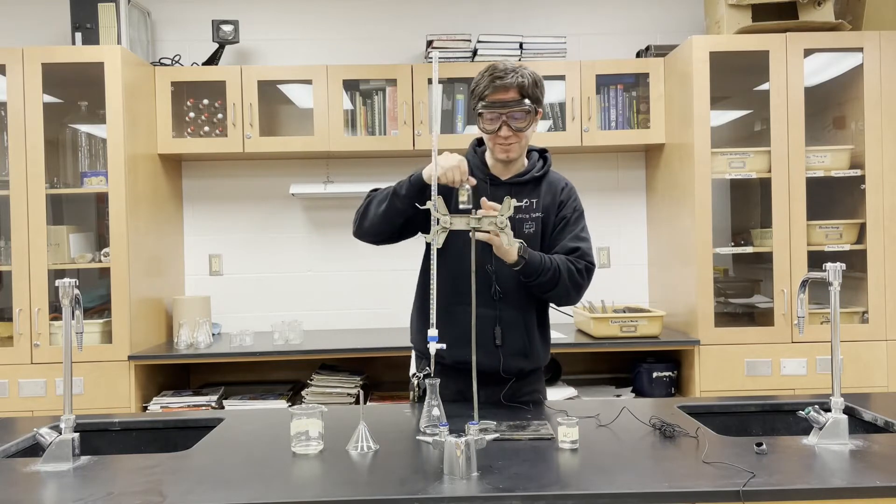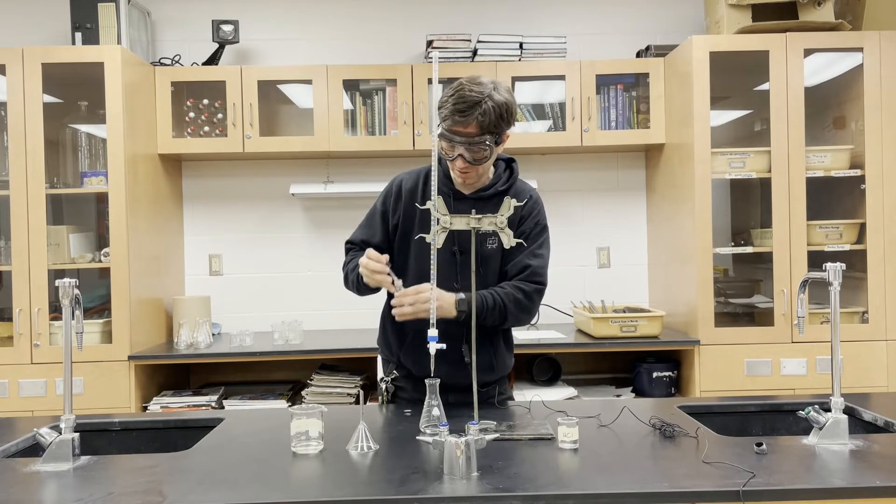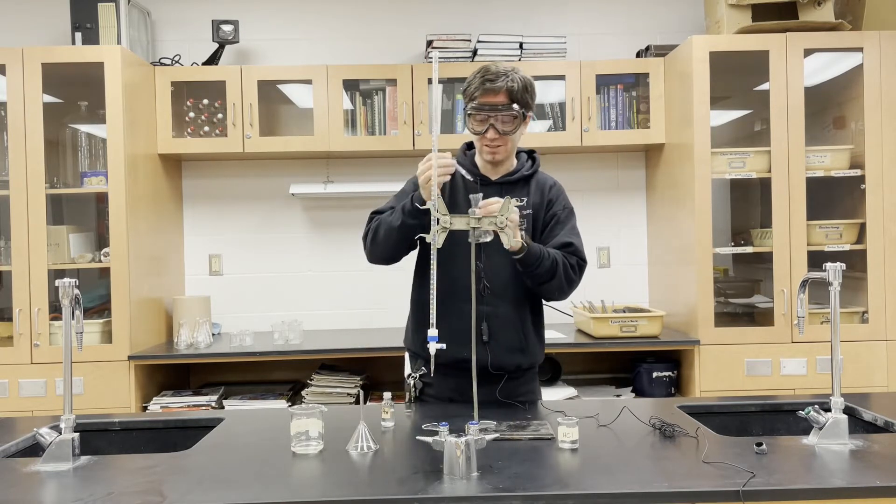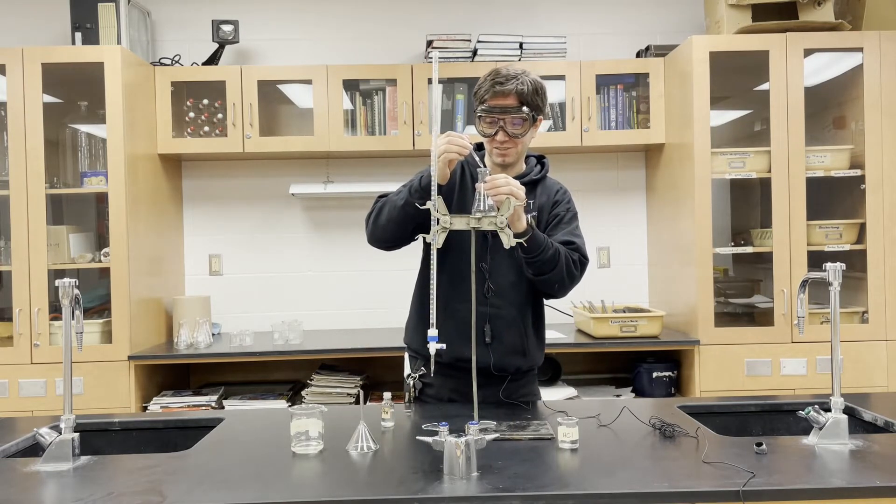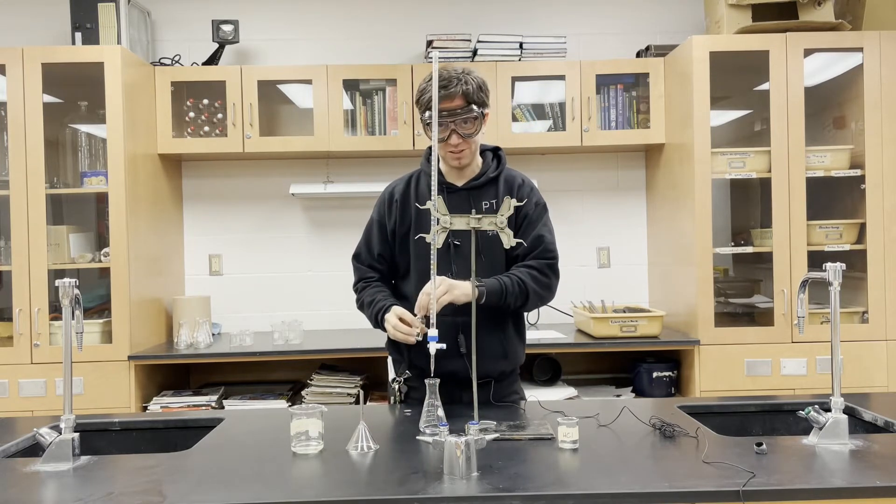I'm going to take some phenolphthalein and put a couple drops into the hydrochloric acid. Nothing will happen because phenolphthalein in an acid doesn't do anything, but it will turn pink in a base.